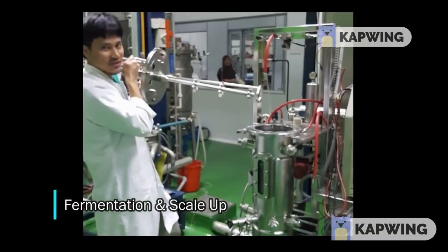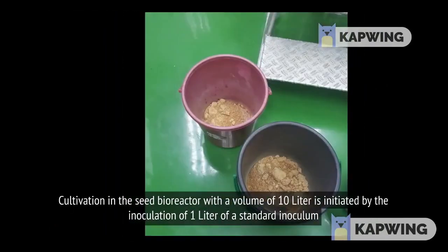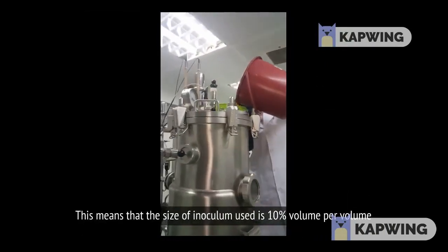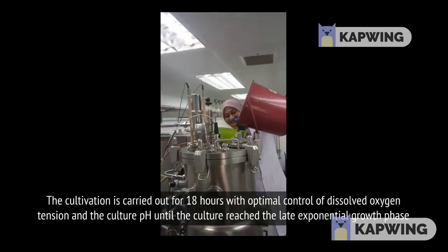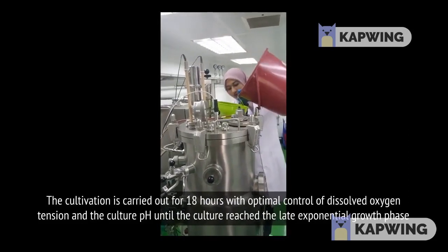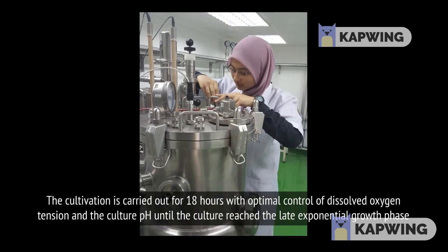Cultivation in the seed bioreactor with a volume of 10 liters is initiated by the inoculation of 1 liter of standard inoculum. This means that the size of inoculum used is 10% volume per volume. The cultivation is carried out for 18 hours with optimal control of dissolved oxygen tension and culture pH, until the culture reaches the late exponential growth phase.